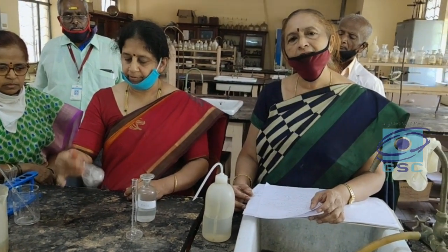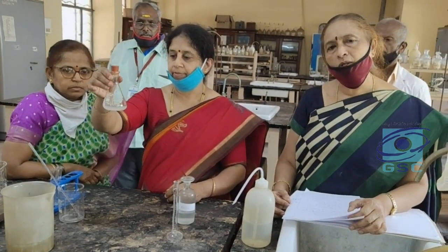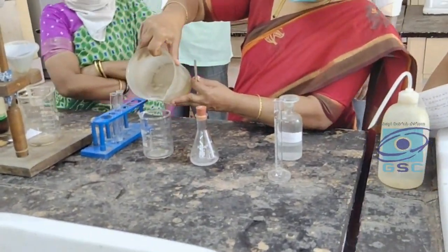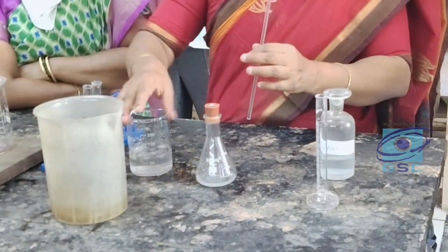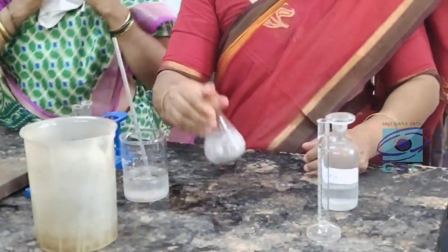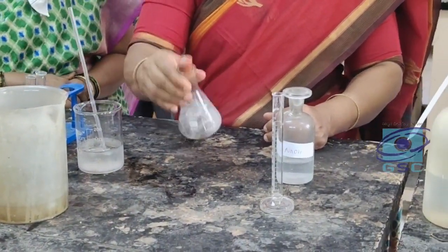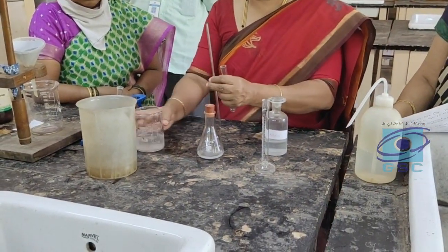Hippuric acid is a carboxylic acid. It is just prepared by adding glycine to benzoyl chloride. Now we will take ice cold water in the cup, and just to test it, I will take a small quantity of ice water in a test tube.